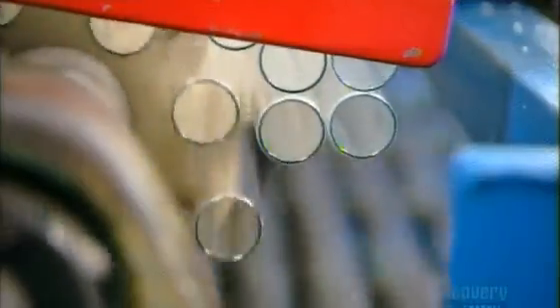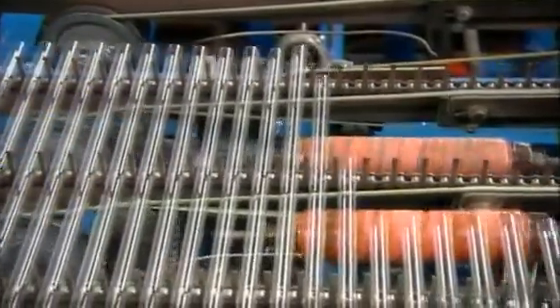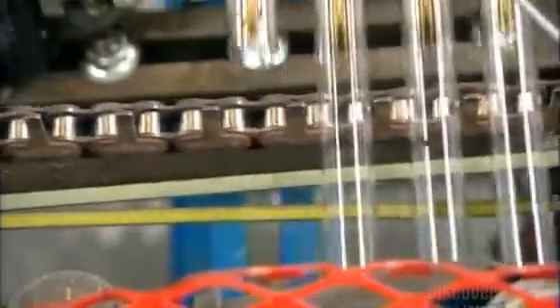As it spins, it drops a tube into each slot on a cutting bed. Then comes the first cut by gas flame. When the heated tubing contacts the wet steel blade, the thermal shock results in a clean separation of the glass. The tubes get a second thermal shock treatment, which cuts them to length.